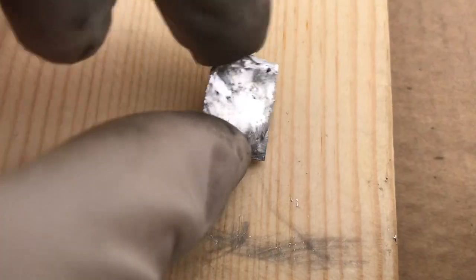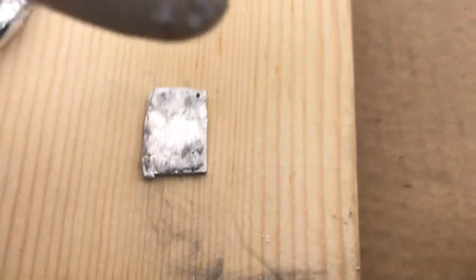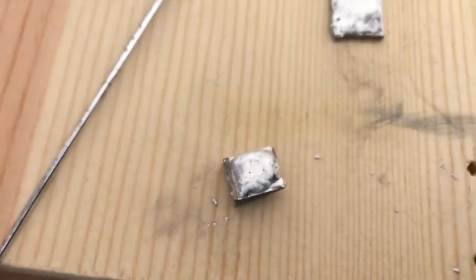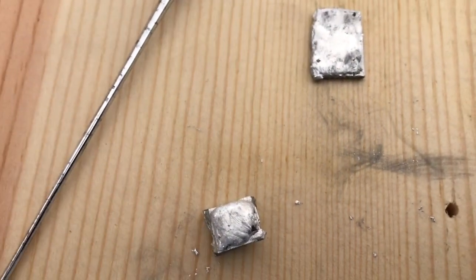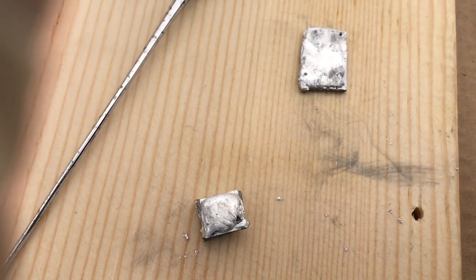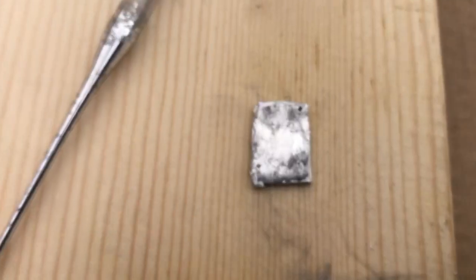Yeah, so it started to amalgamate and you can see the amalgam is kind of sticky and ends up getting onto your skin. So I'm wearing these gloves because of that, and in a little while I'm going to come back and check how reactive these metals are with water.